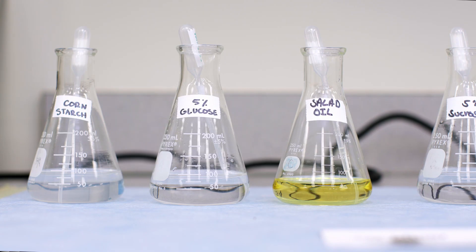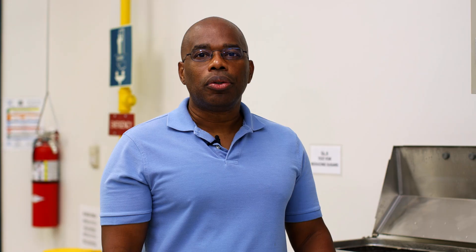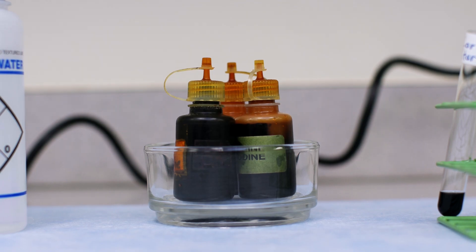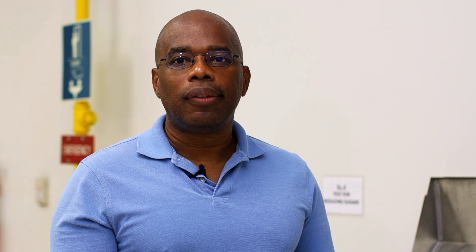But a majority of our carbohydrates come in the form of a polysaccharide — we frequently call that starch. So in this particular test, what we're going to look for is the presence of starch. We're going to use a particular solution called Lugol's, which turns color in the presence of starch.